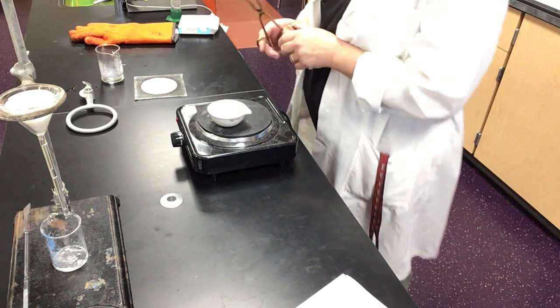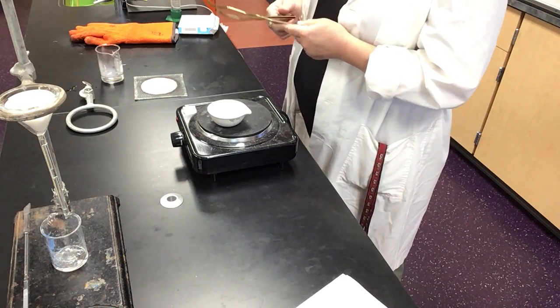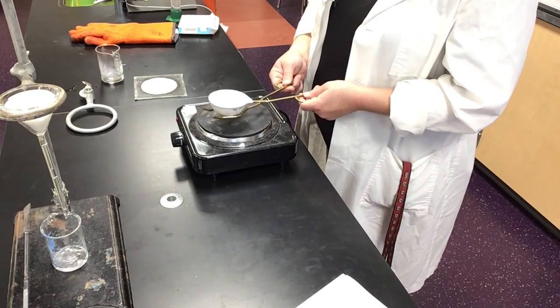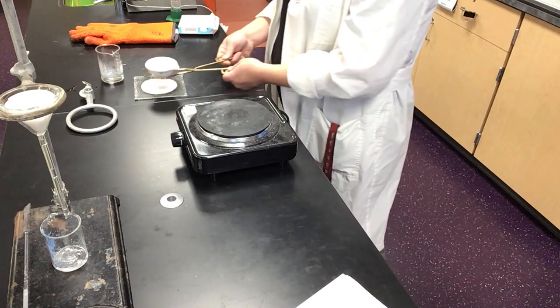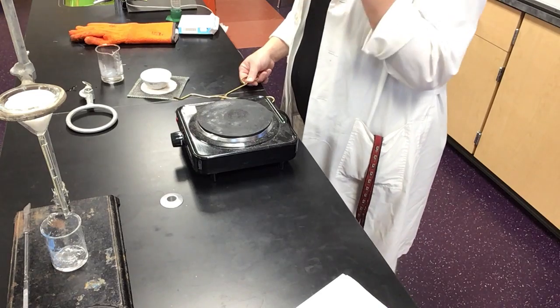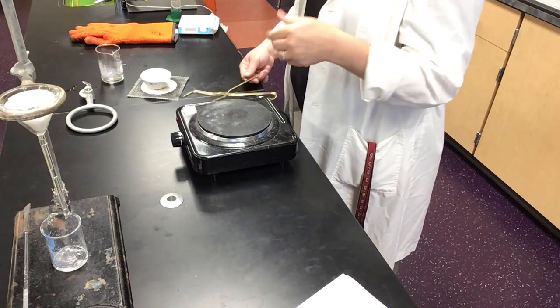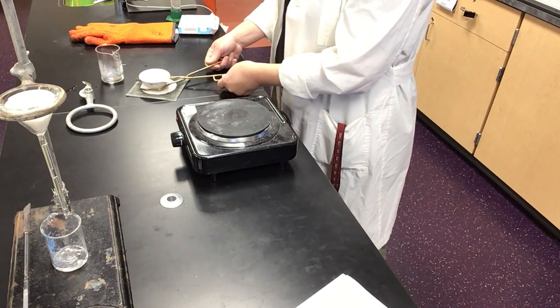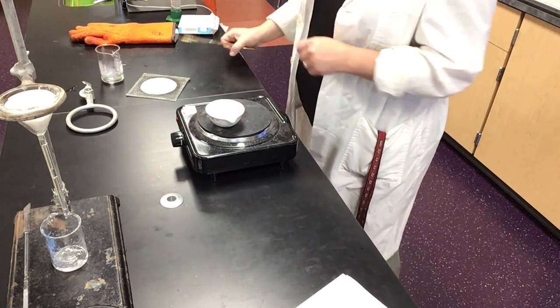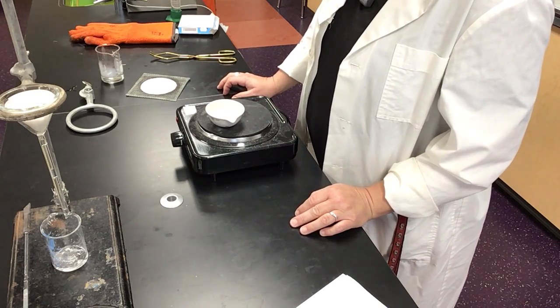It's still spattering. So what I would have to do at that point, it's kind of like correcting in a skid. Once you're in the skid, it's hard to correct. So at this point, I would actually have to remove this from the heat for a little while to allow the temperature of the whole mixture, the evaporating dish, the water, the salt, the filtrate, to come down to a point where then I could put it back on and it would stand a reasonable chance of not continuing to eject material. Nope, still doing it.